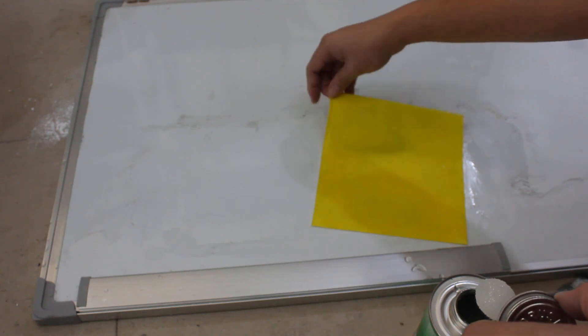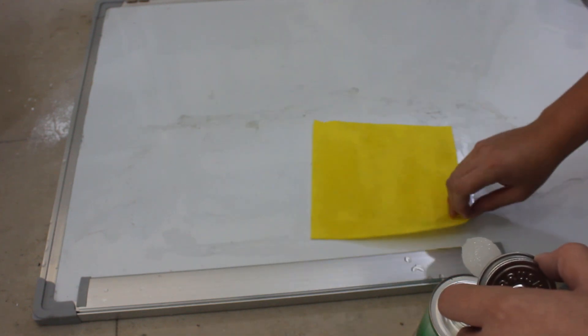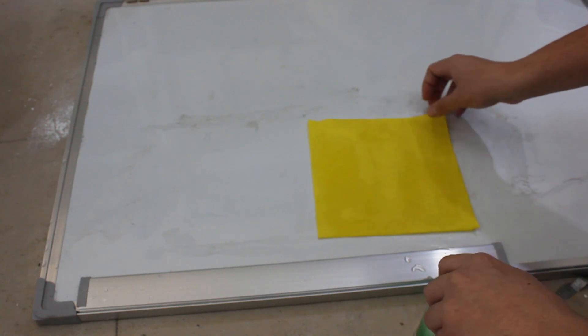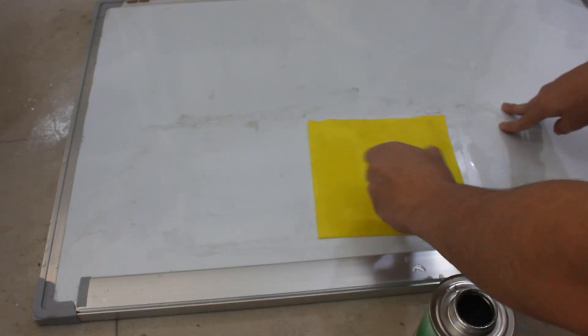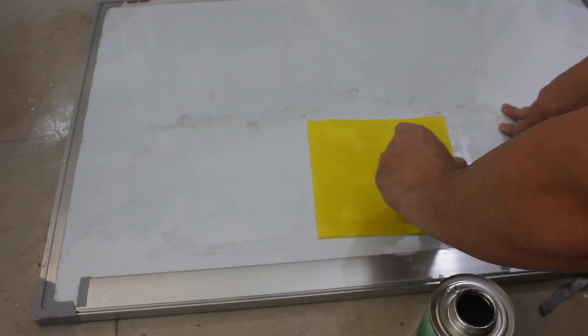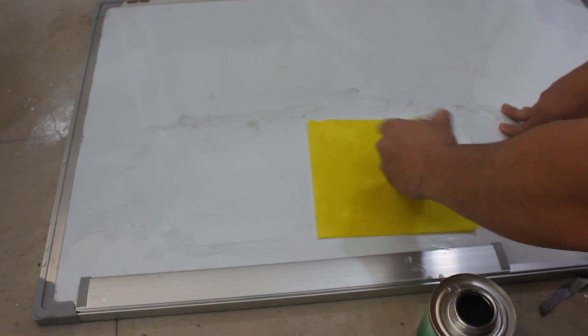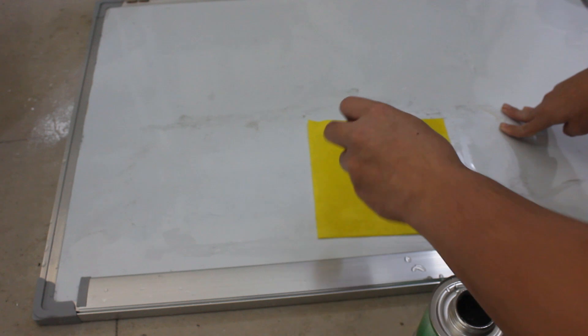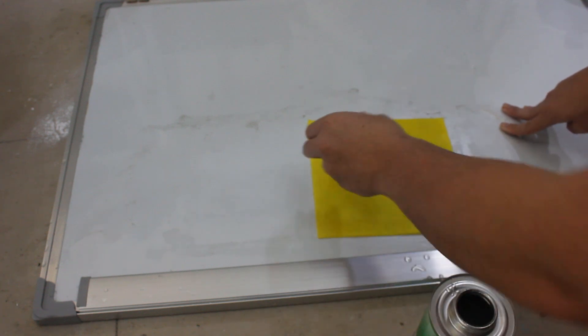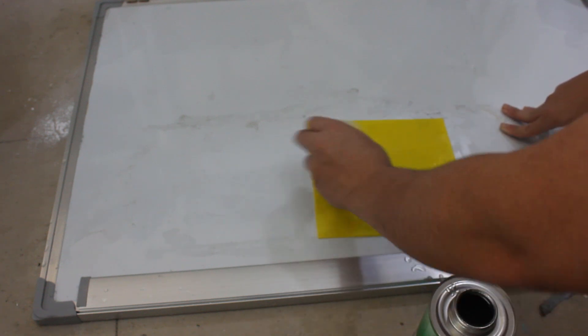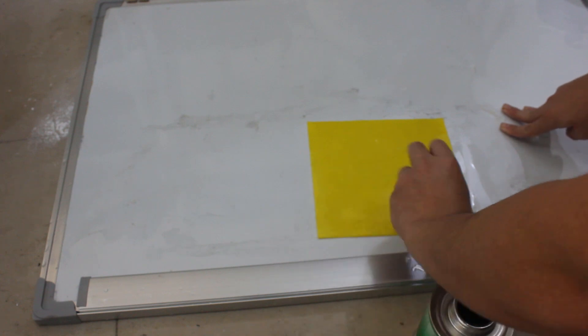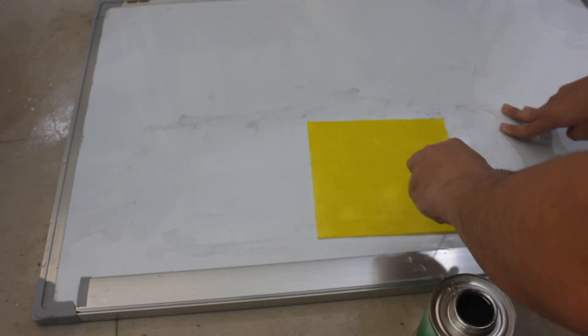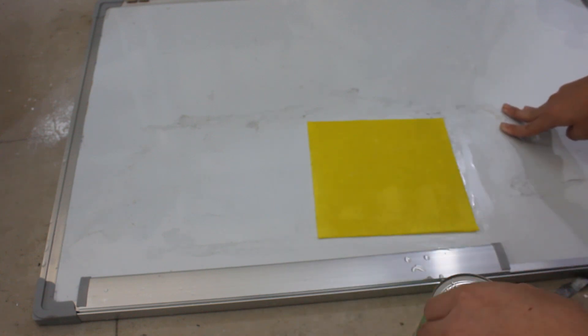What I'd like to do is to leave it with a hot solution of sodium hydroxide at around 80 degrees Celsius for like four hours, and then four hours later I just pick it back up. You can apply as many coats as you want, and then you can check the permeability of the membrane when it dries up. You want as little as possible permeability.